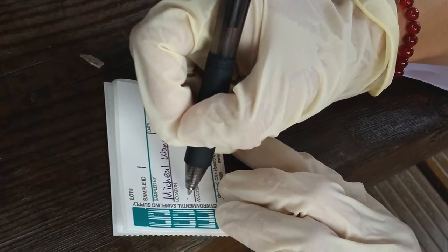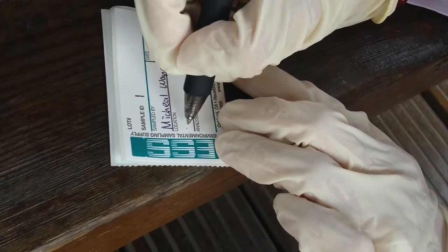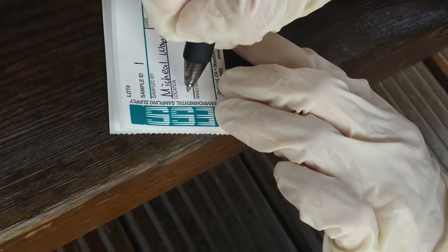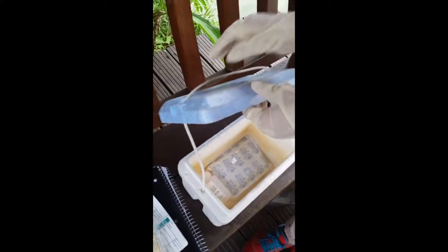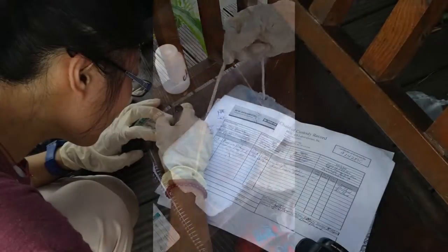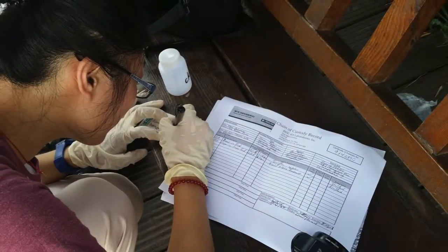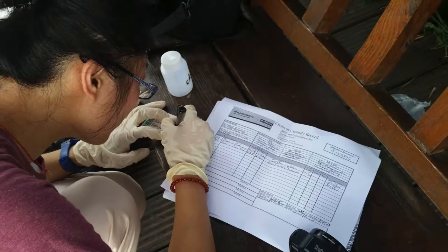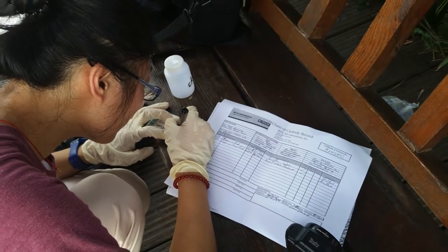Once again, we need to fill out the label with location, date, and time. When the samples are all gathered, we will fill out our chain of custody forms for each sample. This is completed in order to trace the sample position from the time of collection.